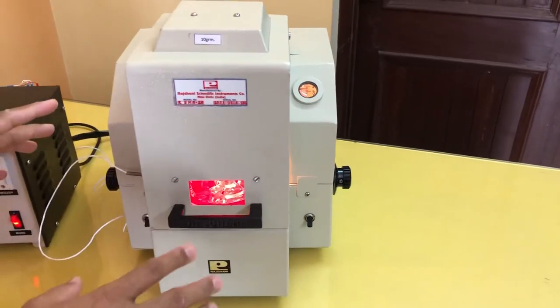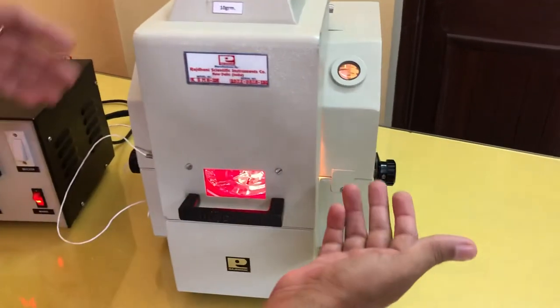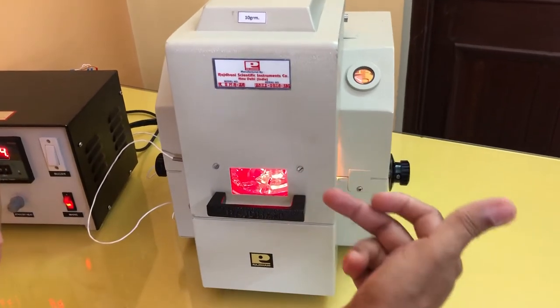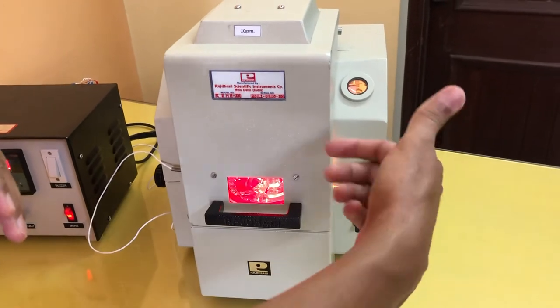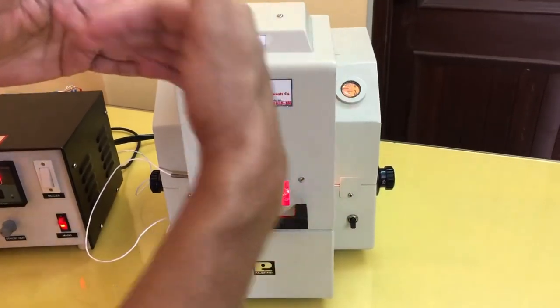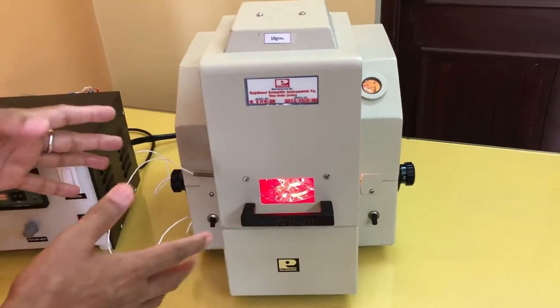This is the fifth point, and all these points are given in the manual also. The fifth point is very important — how to read the reading. By rotating this knob, you have to again bring that pointer to coincide with the reference mark. You have to rotate this knob so that scale reading rotates from 0 towards the positive side — 1, 2, 3, 4. By doing so, you will see that the pointer will come towards the reference mark. Once it has coincided with the reference mark, that corresponding reading on the scale is the direct percentage of moisture.